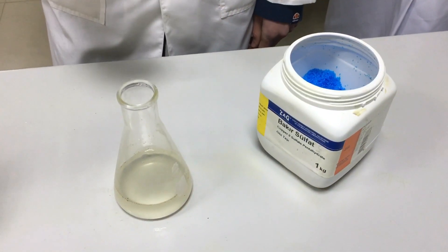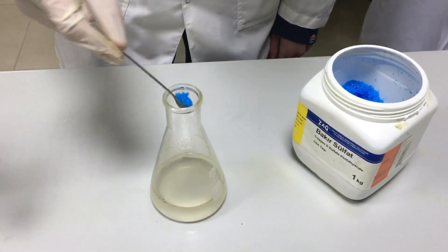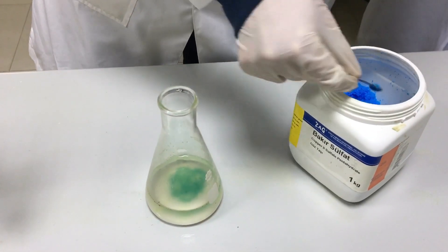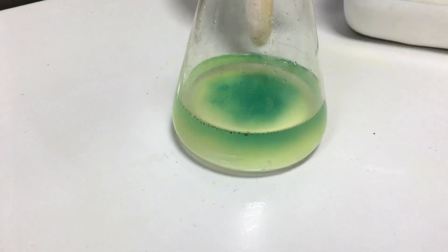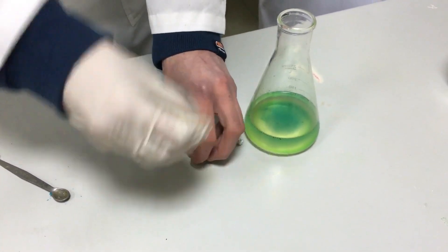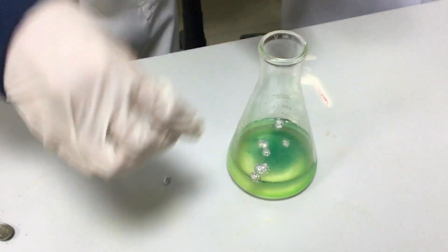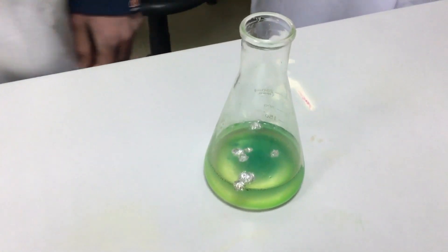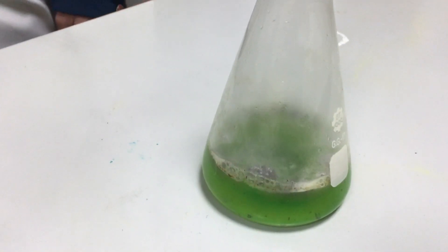Now we are going to put some quantity of copper sulfate into the acid. The green color is the copper chloride. In the next step we are going to put the aluminium into the acid.